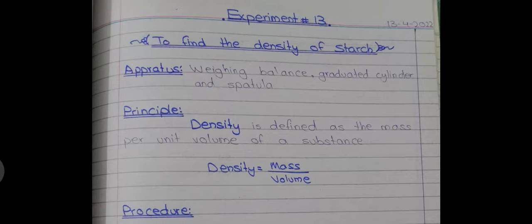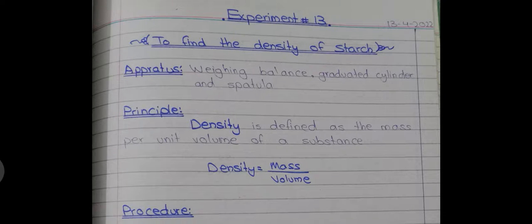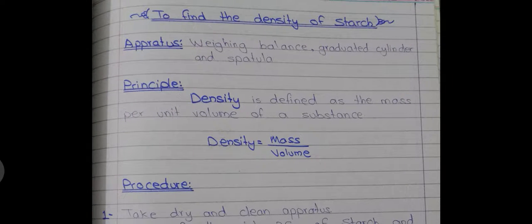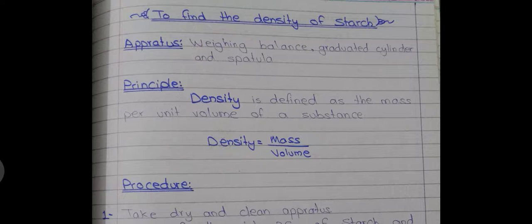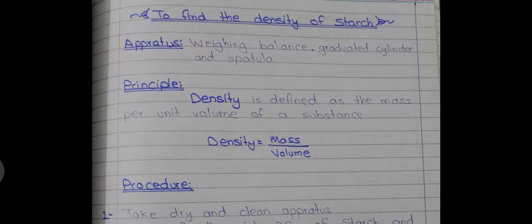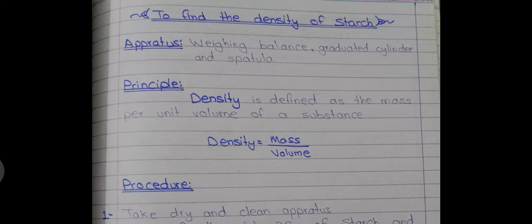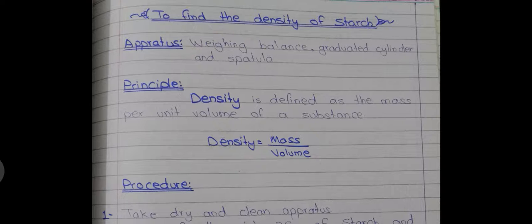Hello guys, in today's lecture we're going to discuss how to find the density of starch. Coming to our topic, to find the density of starch for this experiment we're going to need the apparatus of a weighing balance, a graduated cylinder, and a spatula. Density is the ratio of mass to volume and its formula is: density equals mass divided by volume.